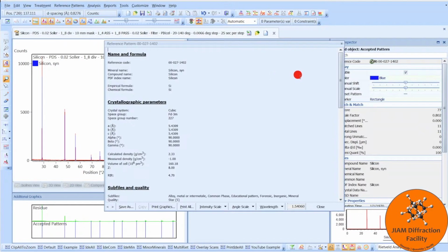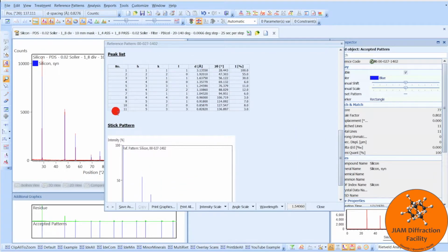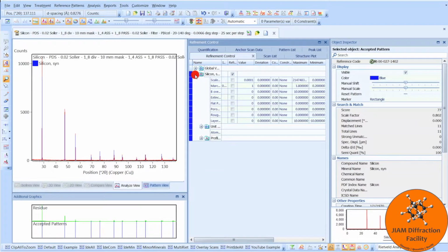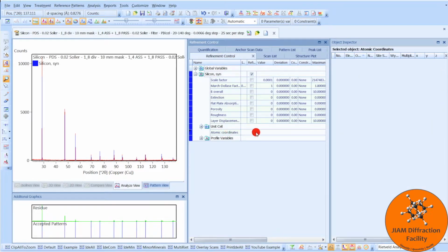If we double-click and scroll down, below the peak list is where you would normally find the atomic coordinates, but we don't see that here, and that is why we can't refine this reference file. If we close and go to refinement control, look deeper into silicon, we see atomic coordinates here, but there is nothing inside.